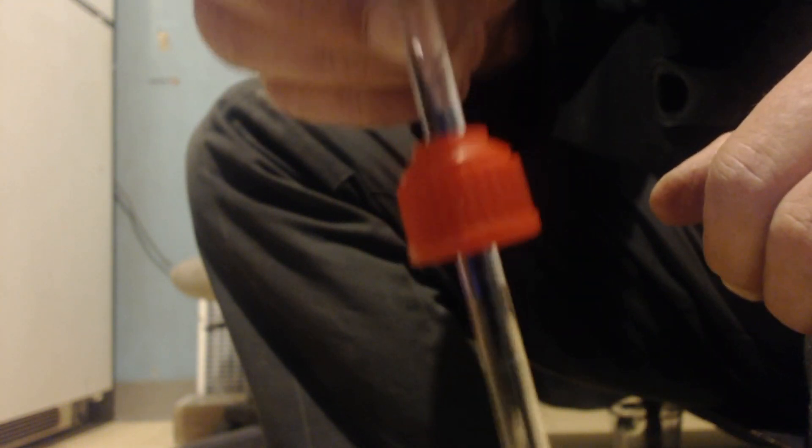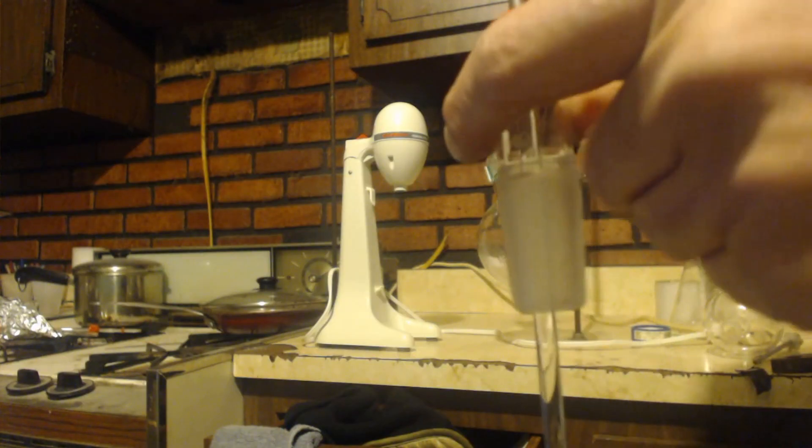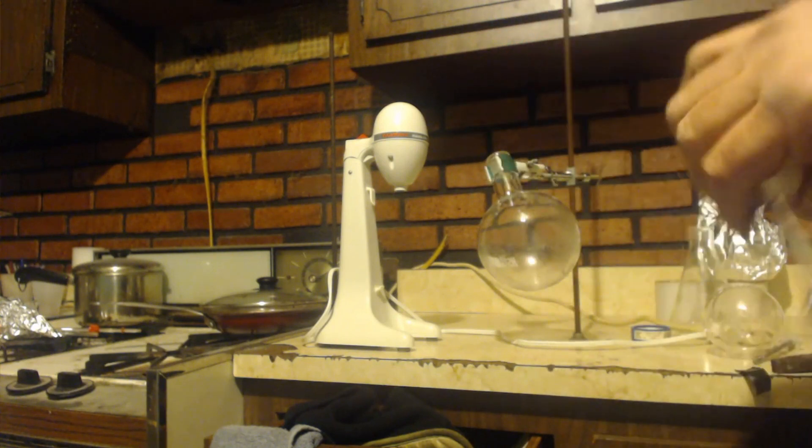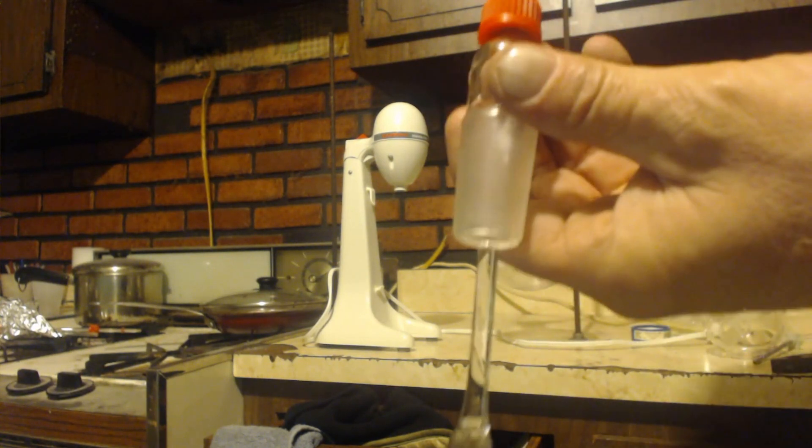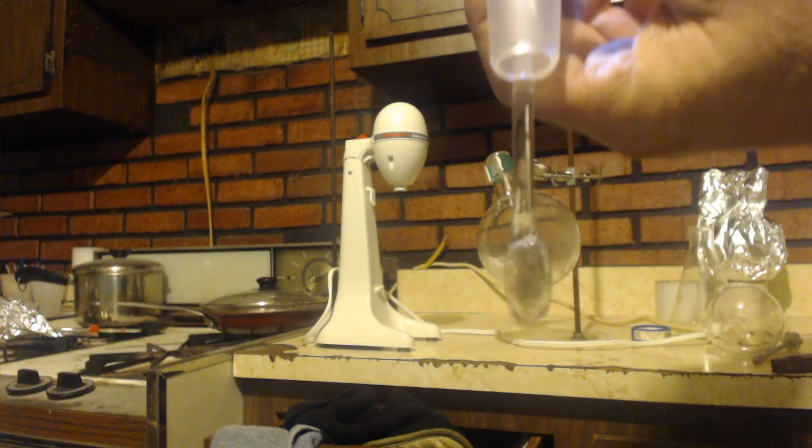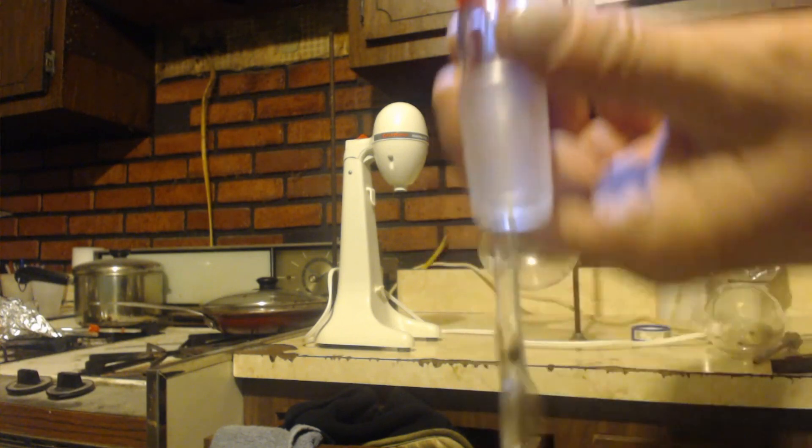That you screw this to, and I wiggled it, this actually started to slide down from the weight. But you can tell it doesn't matter how much I wiggle it with no weight on it, it stays there in the same spot. So it has a good enough leeway to be able to move.